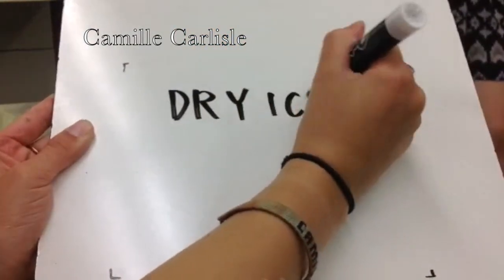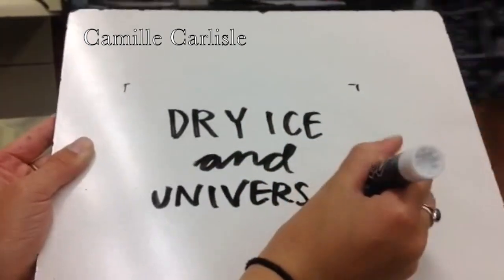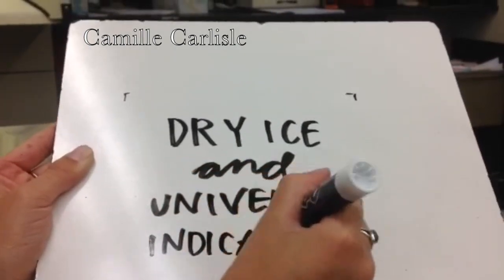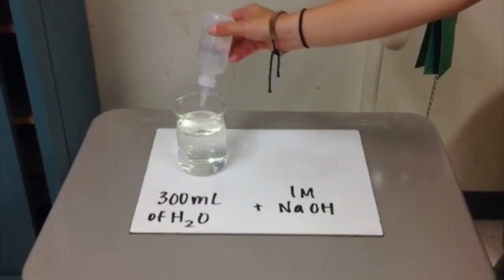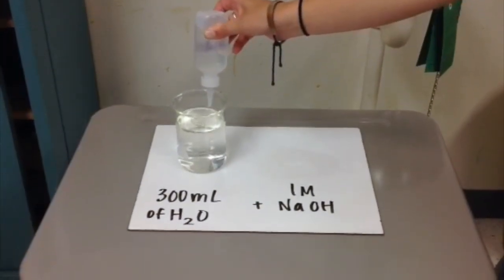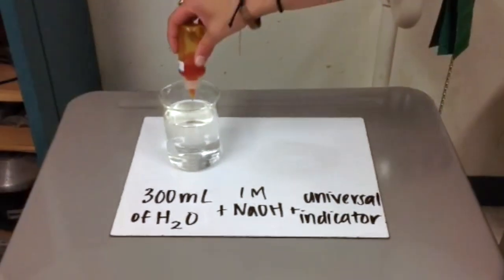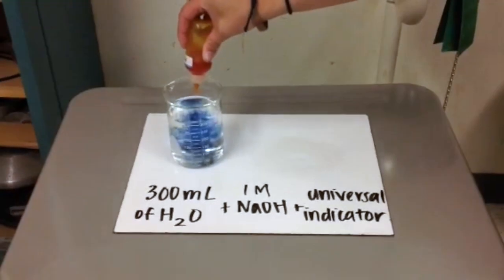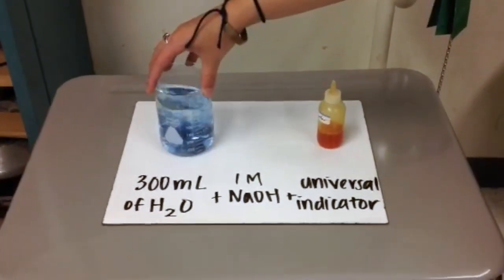Dry ice, and universal indicator. I'm going to add 1 molar sodium hydroxide into 300 milliliters of water and add some universal indicator to show that it is basic and mark the color changes in pH.